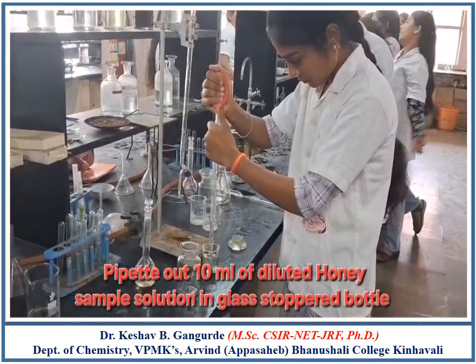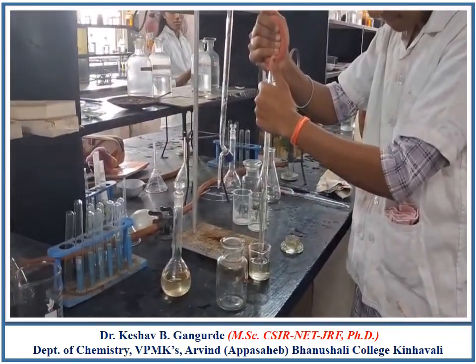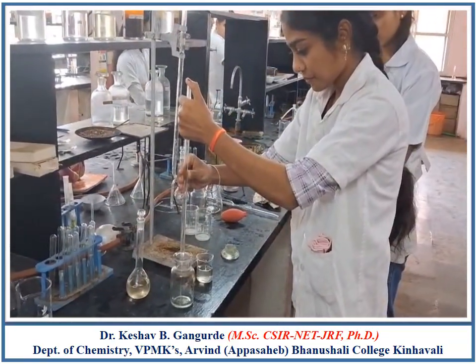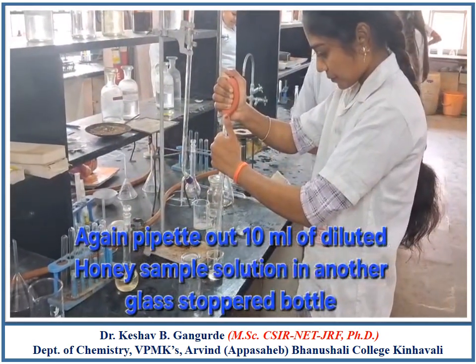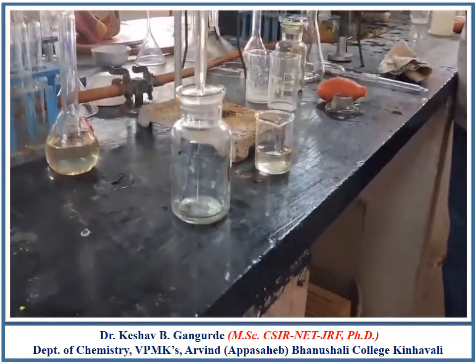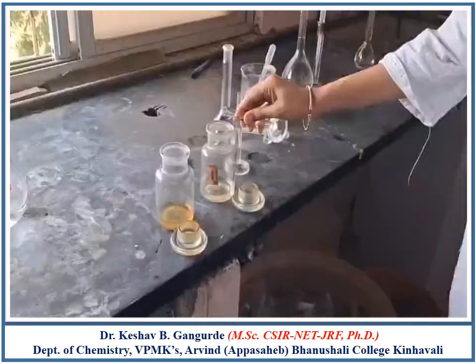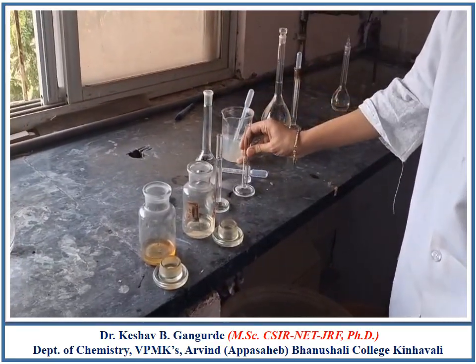Pipette out 10 ml of diluted honey sample solution in a glass stopper bottle. Again pipette out 10 ml of diluted honey sample solution in another glass stopper bottle. Now measure 5 ml of 0.5 normal NaOH in a measuring cylinder and add 5 ml of 0.5 normal NaOH in the glass stoppered bottle.